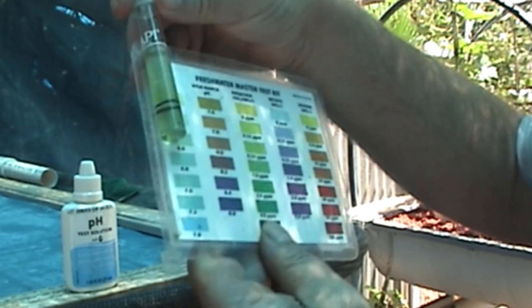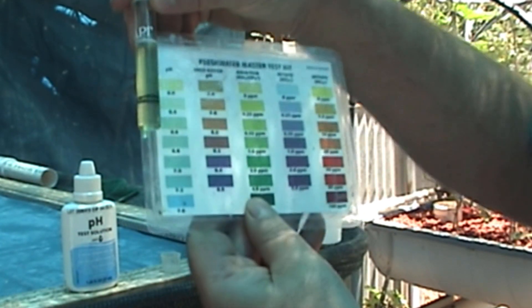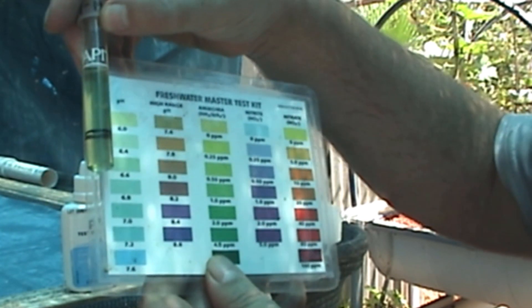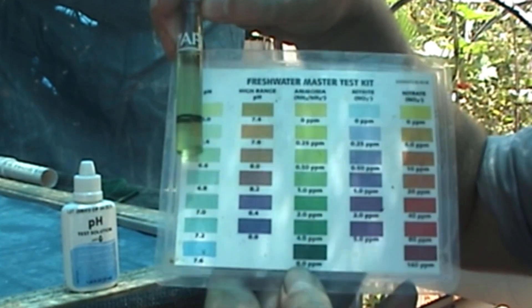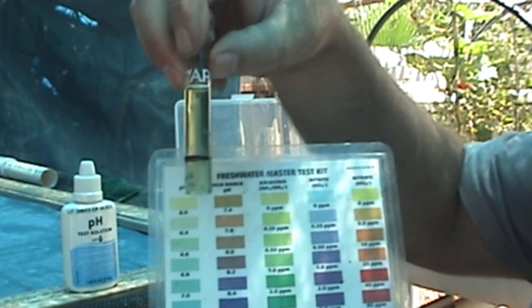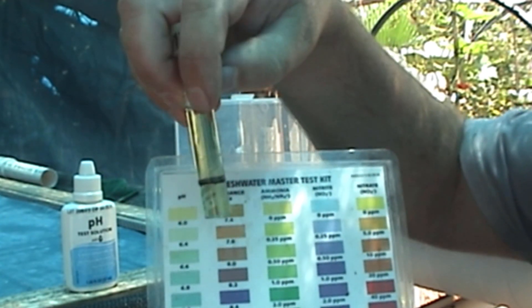What I'm going to do now is match it up. It's saying 6.6, roughly 6.6. We're looking at roughly 6.6. That's the normal test, the normal amount of water you put in for your test to that white level.